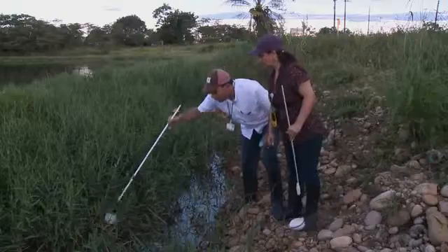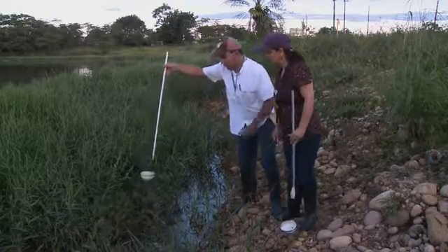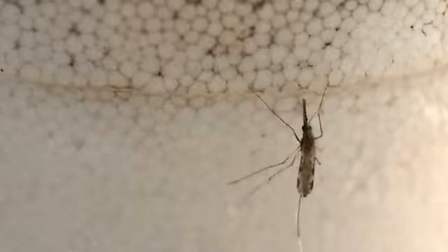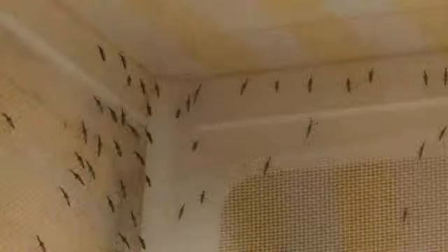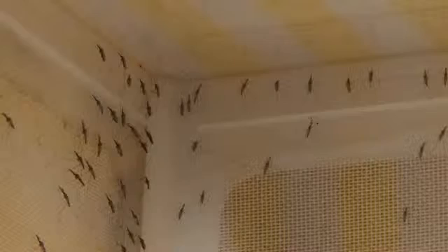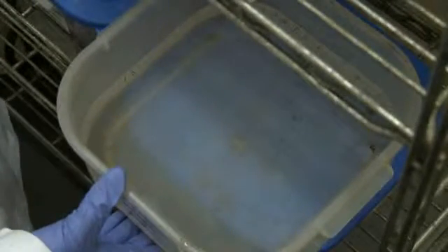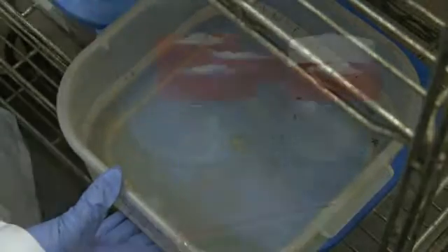There are two ways to generate mosquitoes for susceptibility testing. One would be to collect larvae from the field from the site where you want to test susceptibility, and then grow them in an insectary and use the females. The other method is to catch blood-fed mosquitoes and let them lay eggs and then raise the eggs to adult. Usually non-blood-fed female mosquitoes between 2 to 5 days old are used for the test.